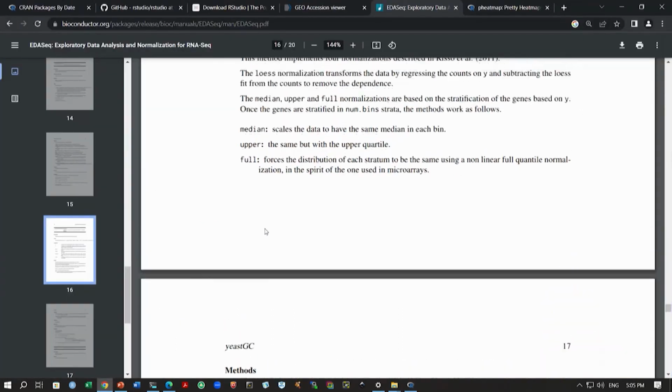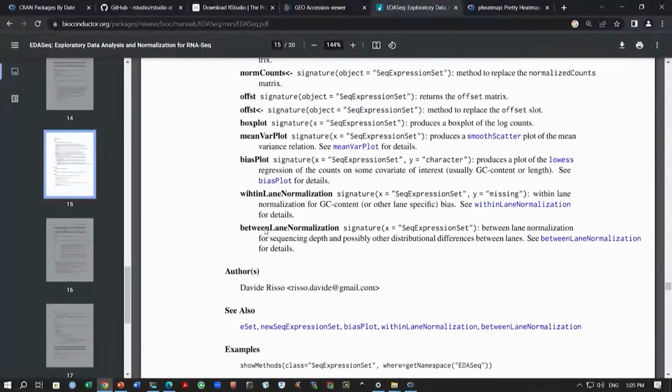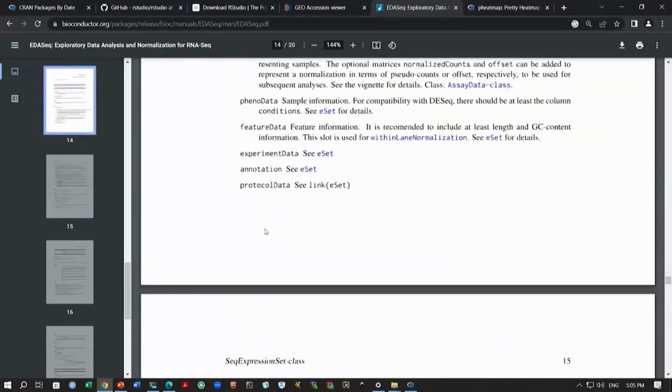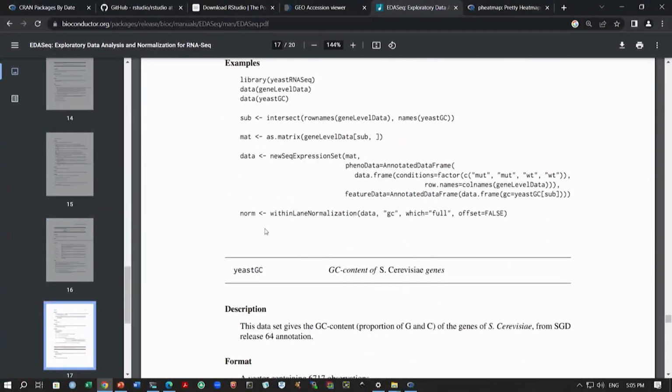So, where we create this new seq data method, right, and you can probably see, so we have this normalization. Okay. So, I will show you here perhaps in one of the examples you can see this clearly, right. This data is created like this, right. You can see this, right. So, we have just replaced this with our experimental design and our data. Okay. And then we are following the GC content, right. So, we want to correct for GC content bias. So, that is what we are going to do after we have created this data set.